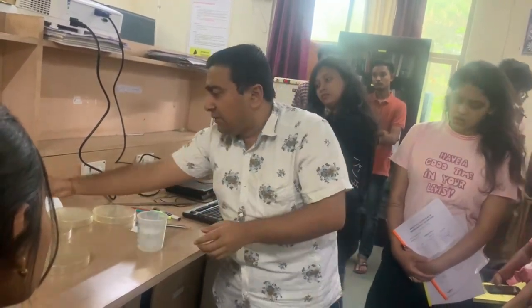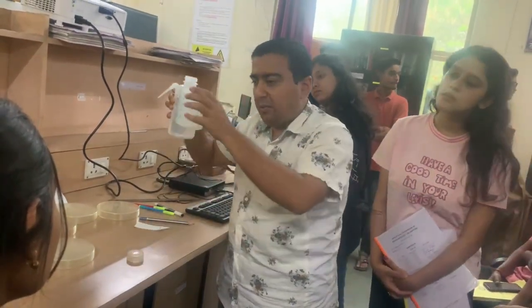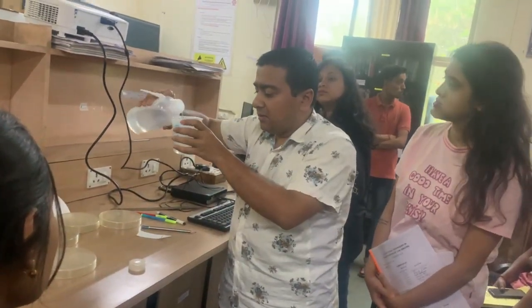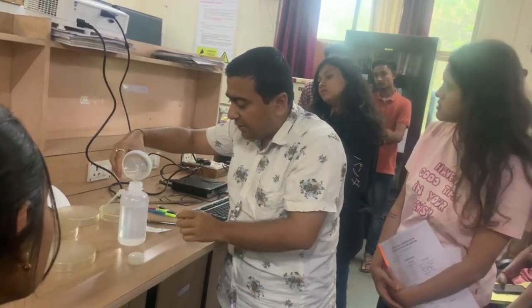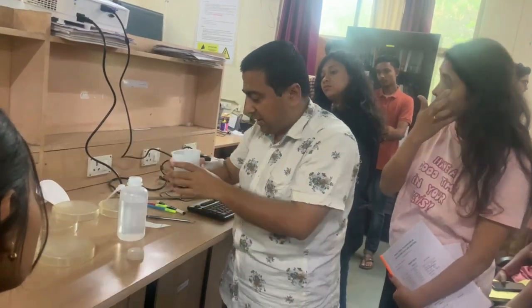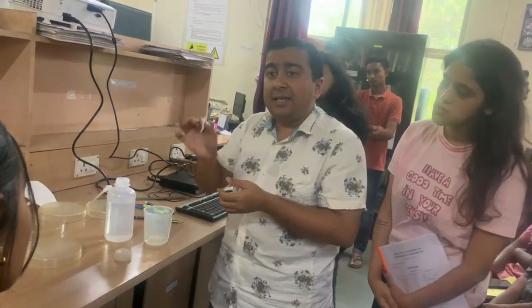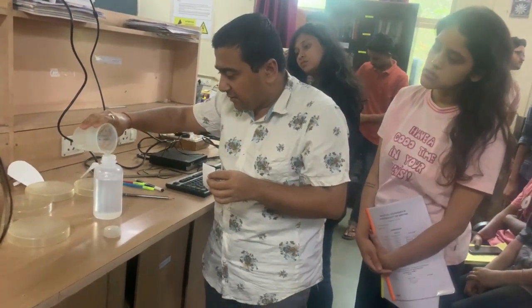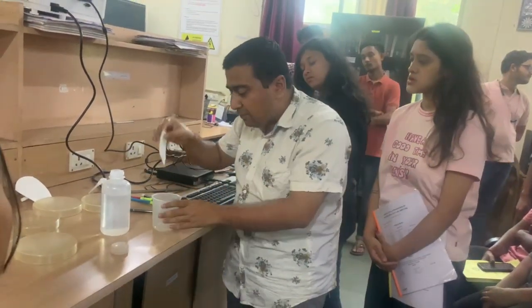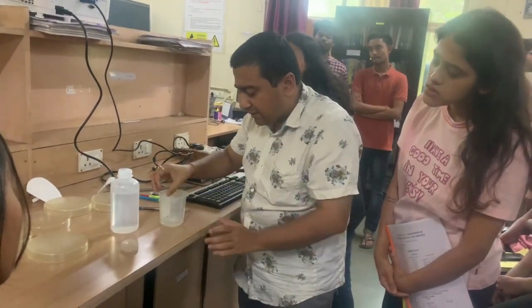So what we will do? We will take this bottle. I'll pour a very little amount of water. Okay, this is my water. I think this is too much, so I'll decrease the water amount. Now it will depend, you have to understand. I'm just showing you, and you have to place it in such a way that it should not fall inside the water. So I'll decrease more water, and you have to be very careful in placing this part. You just have to place this. See, just place this.